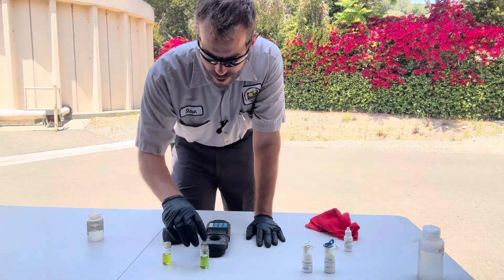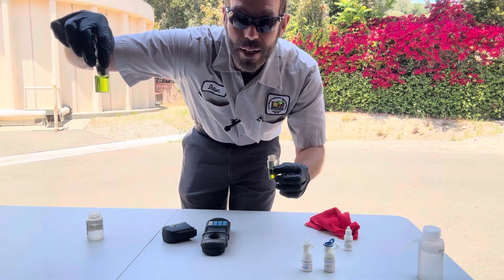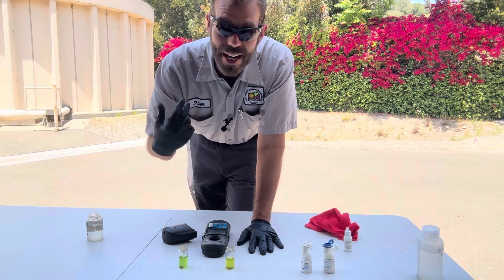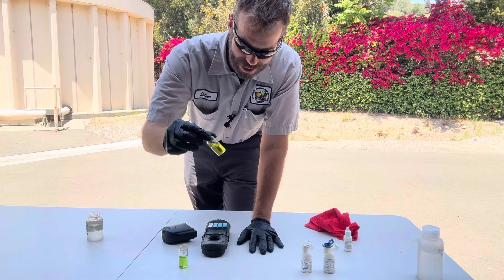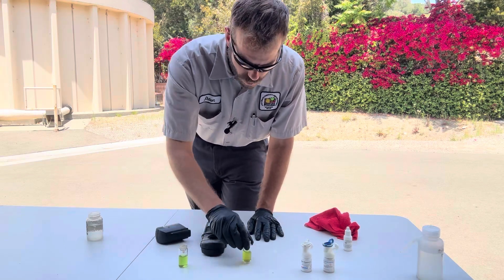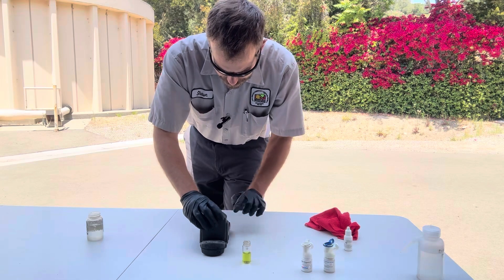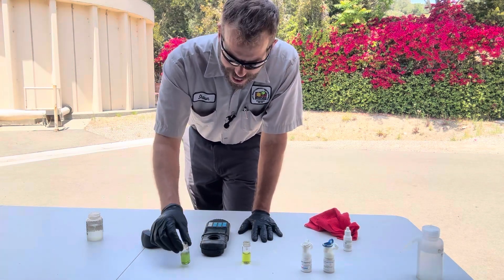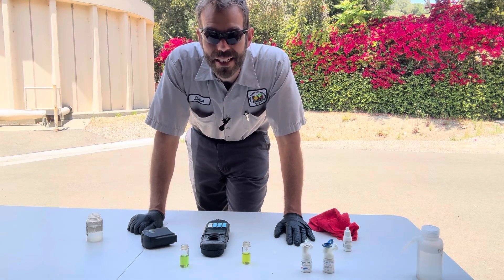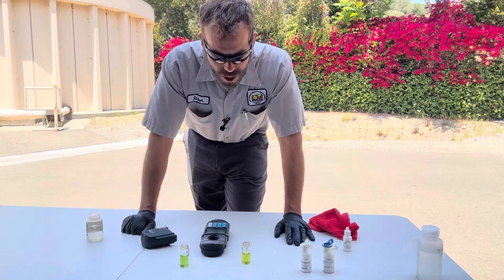The five minutes is up. I've got my two samples - the one I chlorinated and my actual monochloramine sample. Unlike a DPD test where you zero out with clear water, here I use my monochloramine as my zero and compare it against the one that had the ammonia bound by the chlorination drop - that tells me the difference between the two. I'm reading out 0.2 milligrams per liter. That's not a lot of free ammonia, but I do have to oxidize the chloramines that are in there.